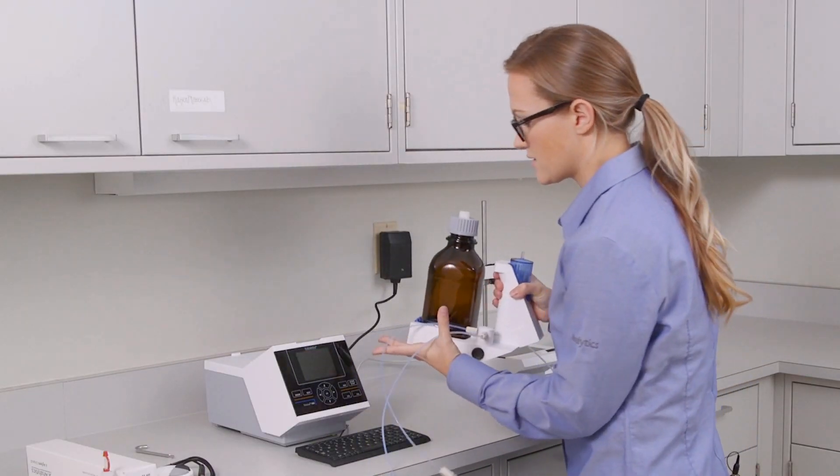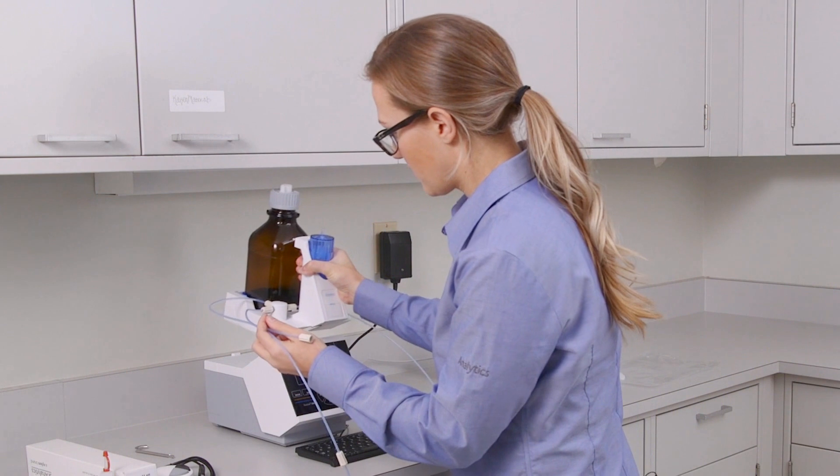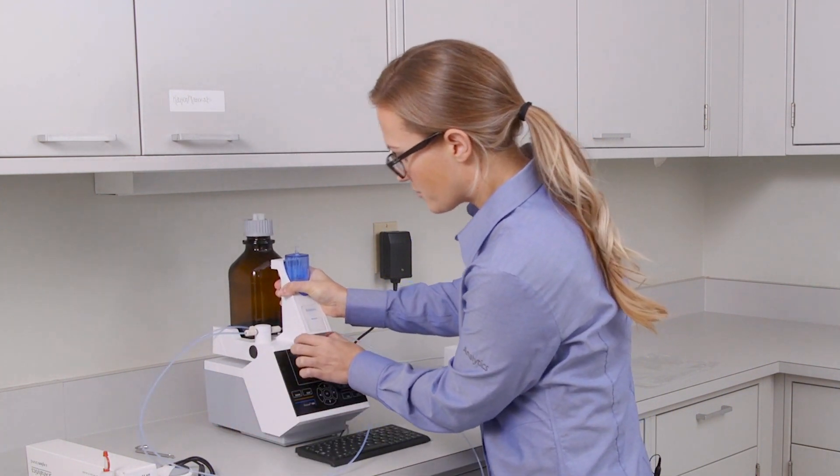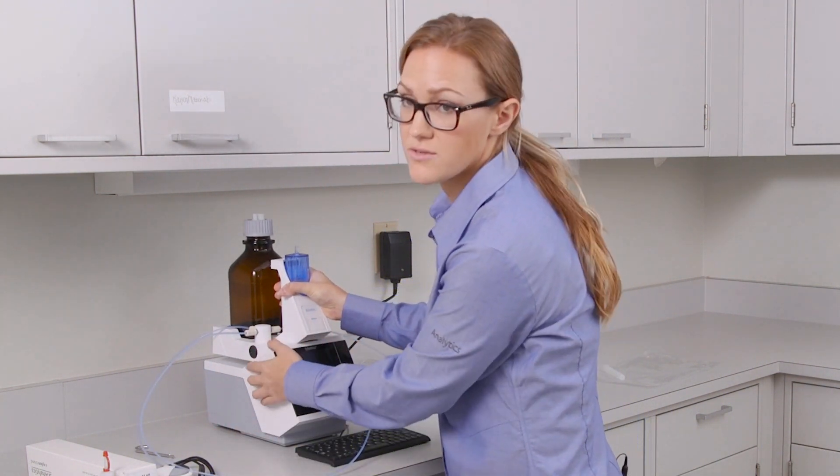And now you're ready to slide this onto the base unit. So we'll line up the sides here and just push down at a 45 degree angle until you hear a click.